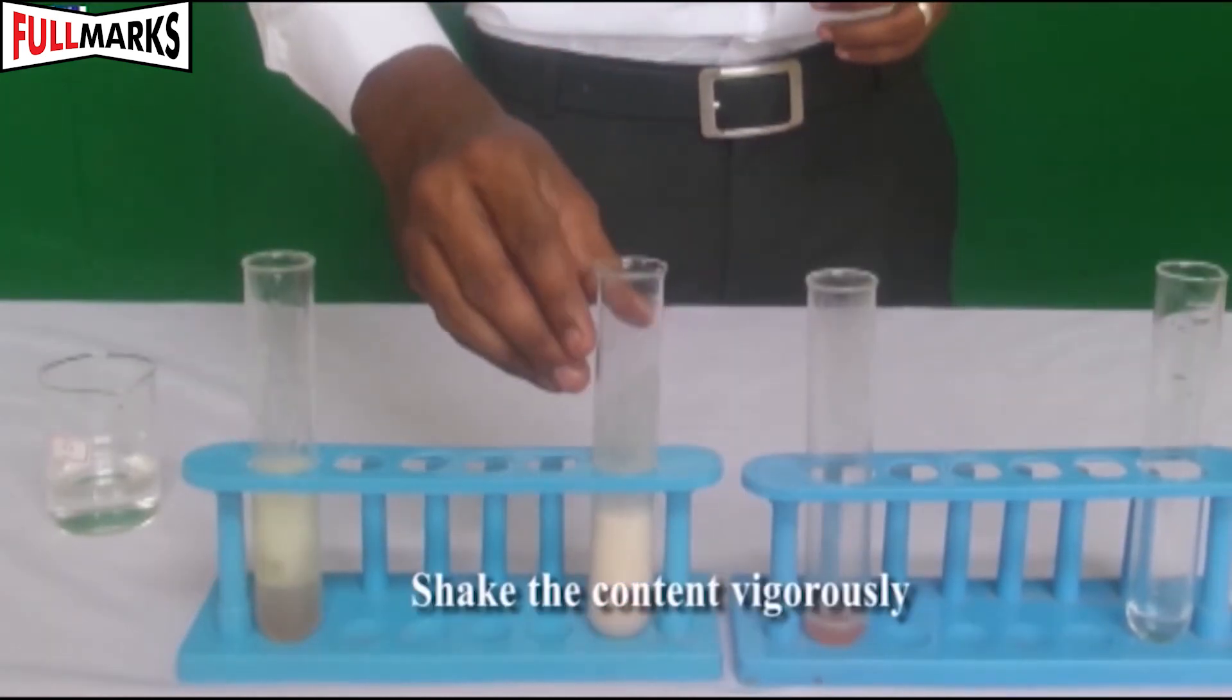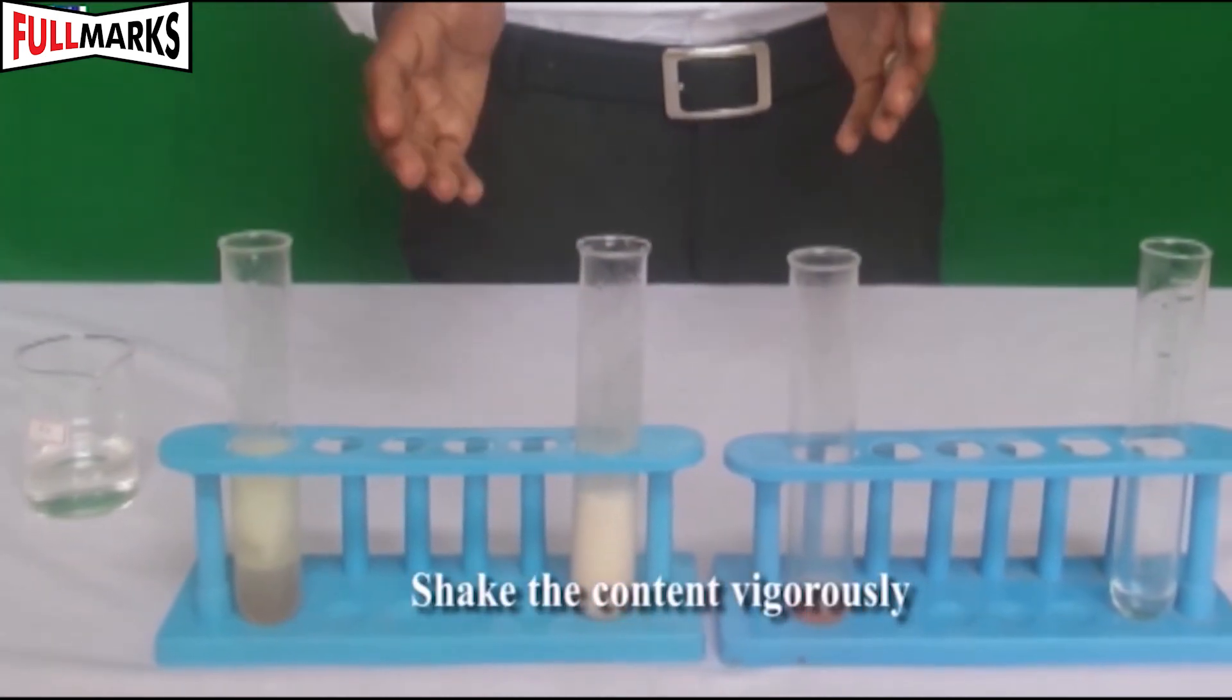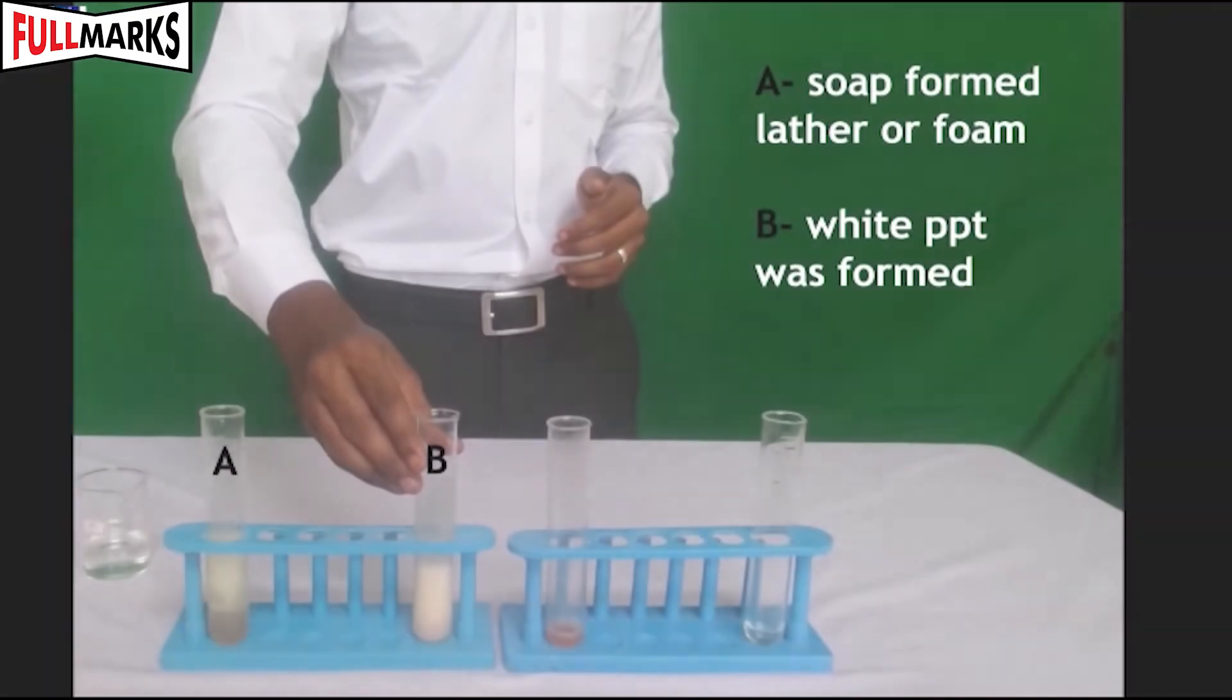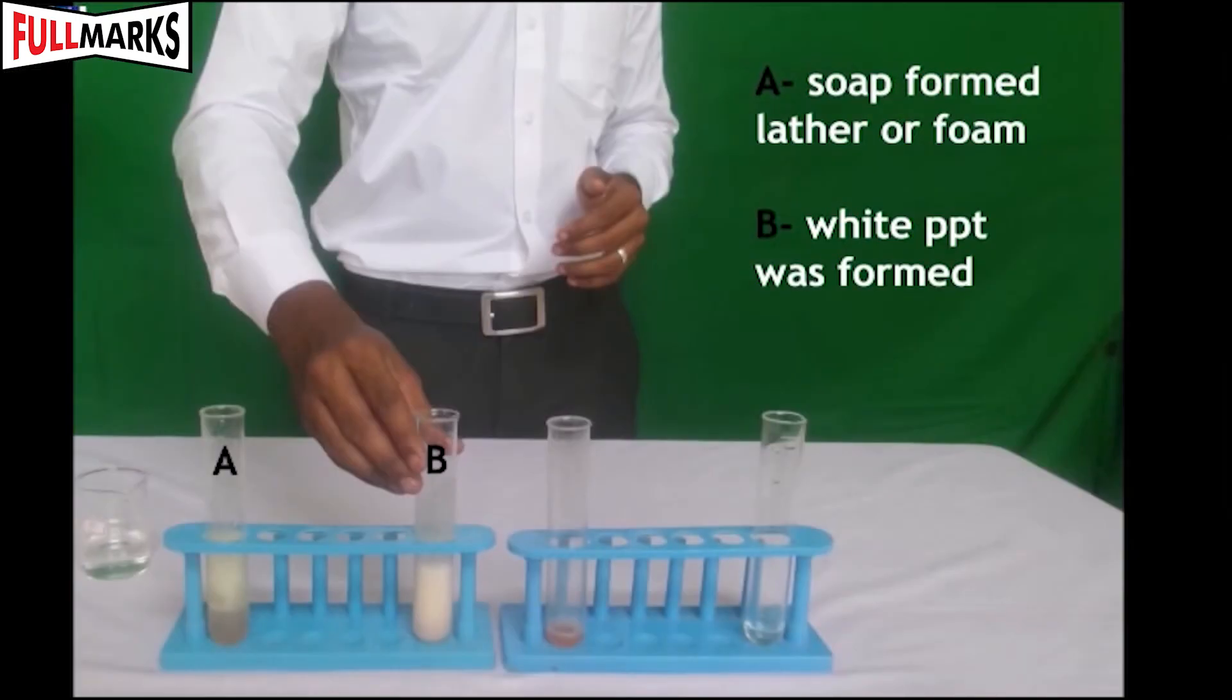Shake the test tubes A and B vigorously for an equal period of time. Keep them in the test tube stand and record your observations.